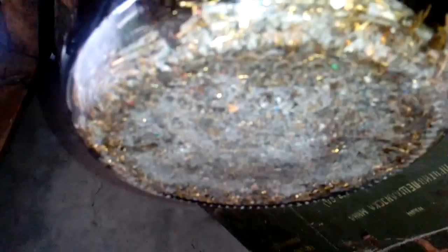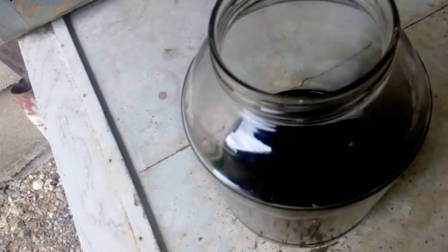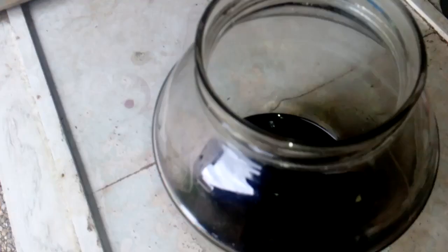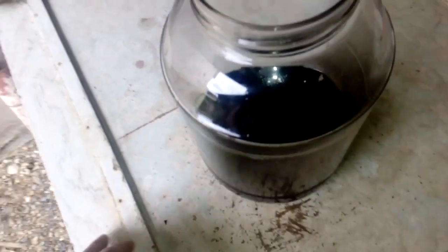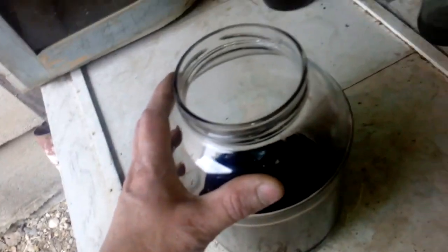You can already see it's starting to disappear. When the HCl saturates and eats all the tin it starts to eat more copper. Before the tin disappears from the pins you get this white stuff, but once the tin is gone everything is good from that point. See you in a couple of days — we'll let this finish its job, and the foils are looking very good.